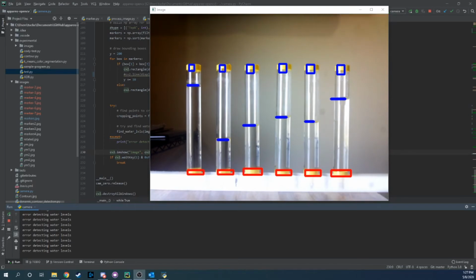So just a brief overview of how we do this: we detect the top marker and we detect the bottom marker, and then we crop on what we call the area of interest, and then we do Canny edge detection to find the edges, and then we look for a horizontal line. One of the filters on lines is the angle, and then we make sure that it's at least 10% of the width of the tube. Otherwise, it would more than likely just be a point of light, so we have to be able to filter that out.